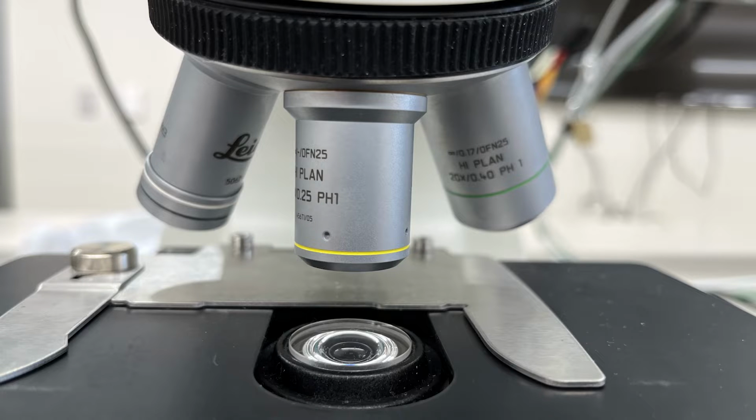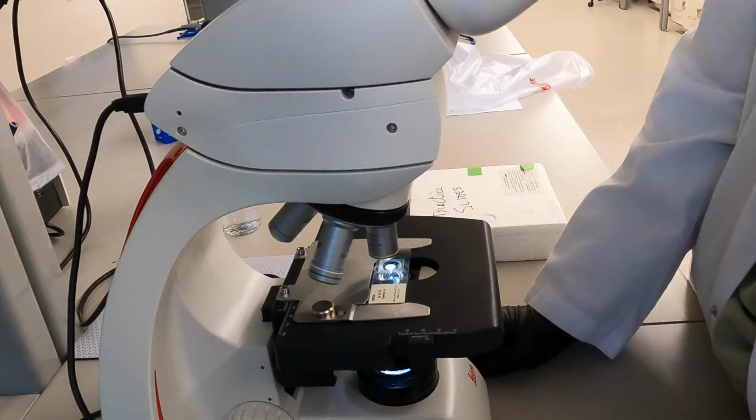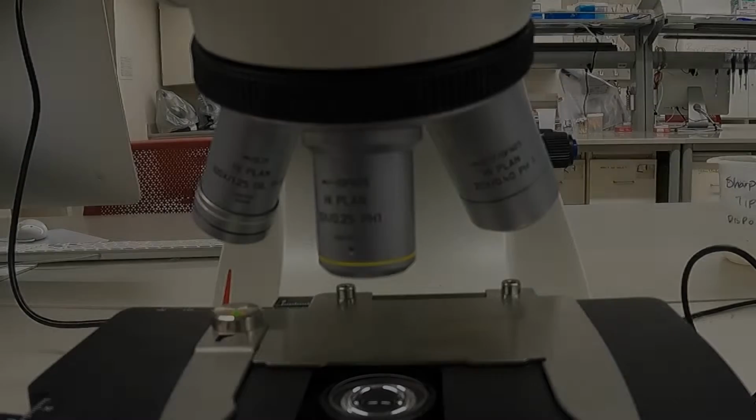Once the sample is in focus and you have gathered all the needed data at the current magnification, you can shift to using a higher power objective. There is a common misconception that when changing objectives, the stage needs to be lowered, but this is not necessary. To change objectives, look at the microscope from the side and use the revolving nose piece to slowly rotate the next higher powered objective into place.